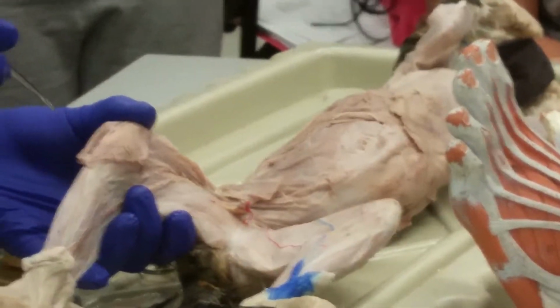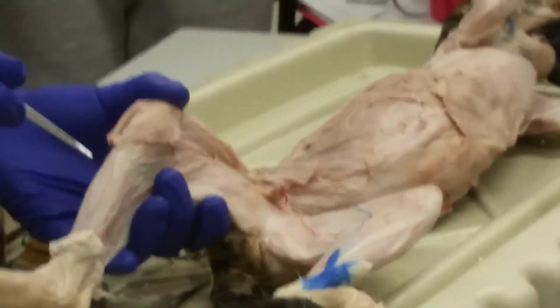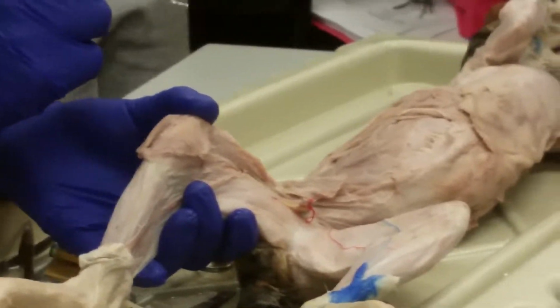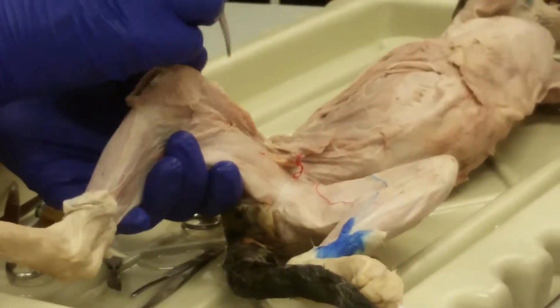Come on in a little bit closer. You can find a spot. He's going to come around there, get behind you maybe. You got it? It's like dissection projections. I wish I had a better one.